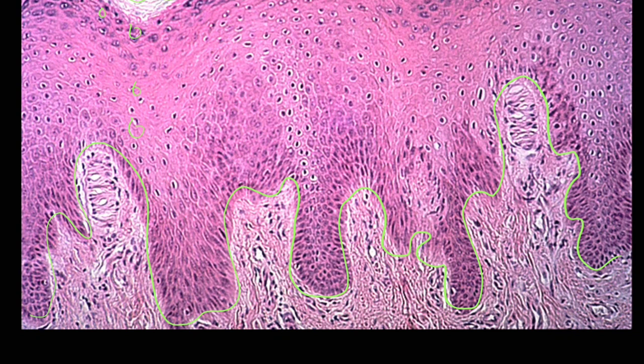Now that we have located that basement membrane, we want to look within these dermal papillae, these finger-like projections. What we're looking for is almost a thumb-shaped structure, which is a receptor, in this case the tactile receptor or tactile corpuscle, for that light touch. We don't see anything here. This is just connective tissue, but we do have this round structure here. It's almost like a cocoon, if you want to think of it that way. And then we have another one on the right, another cocoon shape.